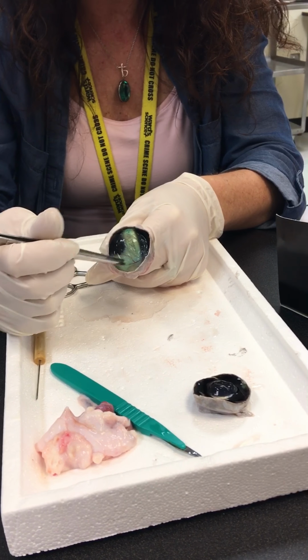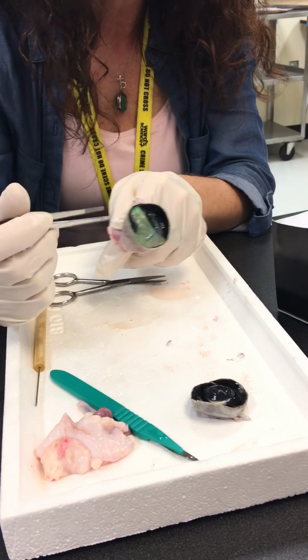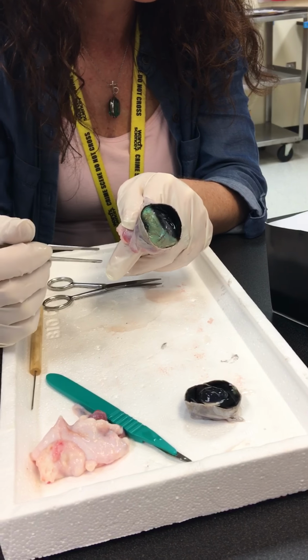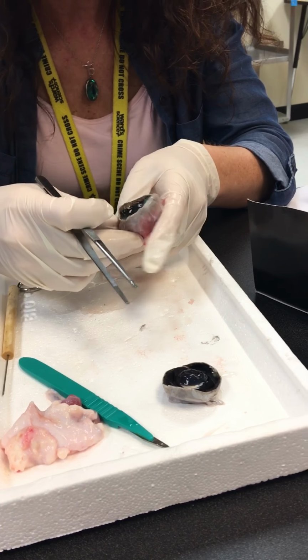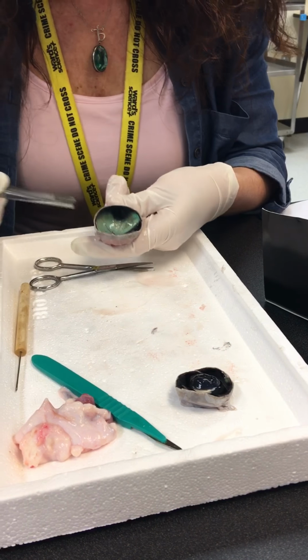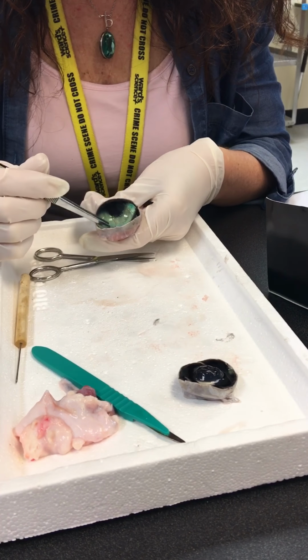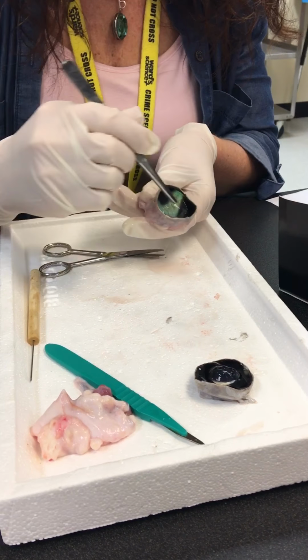What it does is reflect the light, and so it helps them at nighttime to be able to see better because it makes more use of the light that is coming in. It reflects it, and they can see a little better. But do you see this little milky colored thing here, this little structure? I'm moving it around. That is your retina. Your retina is extremely thin, but you see there's some blood vessels in this one. You can see the blood vessels in there.